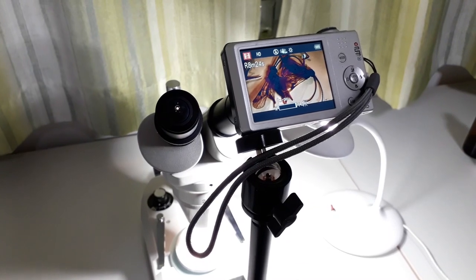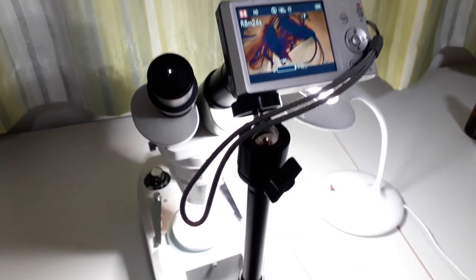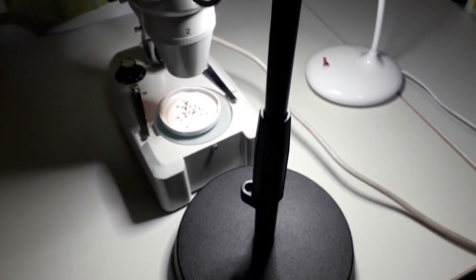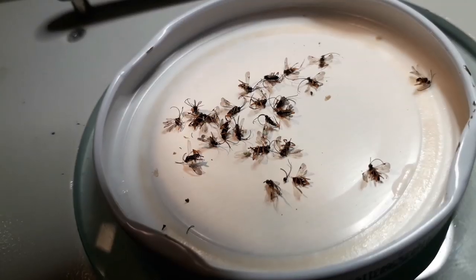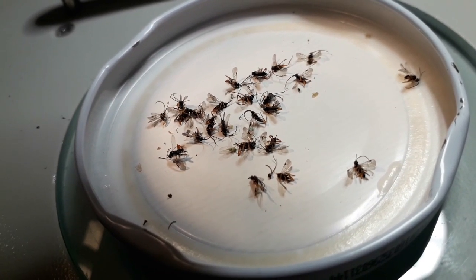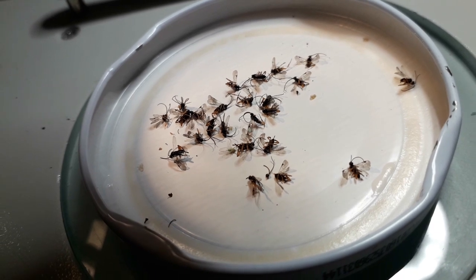Well, of course, the first obvious thing is you want to look at those insects under the stereo microscope. So this is what I did. This is my setup - I put a camera in front of the microscope eyepiece, the wasps are placed on the stage, and I had a closer look at 20 and 40 times.